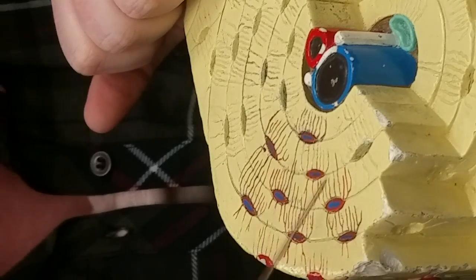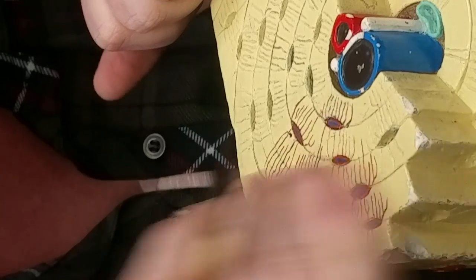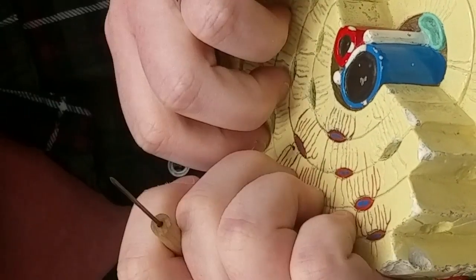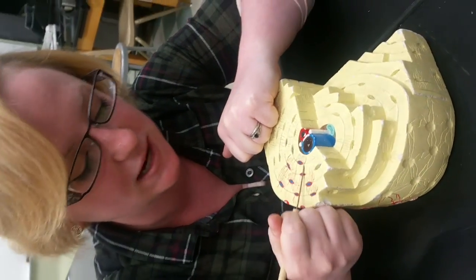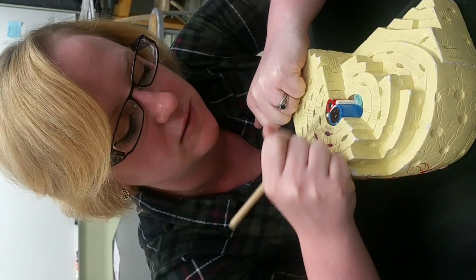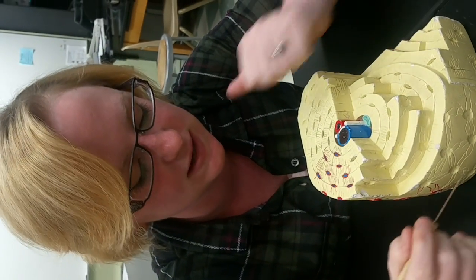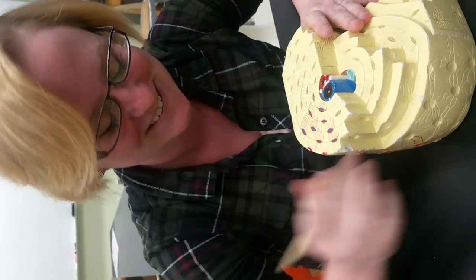So the way I always remember this is if you think about the life of this particular kind of cell, it can't move around, it's stuck in this one place. And it's in a solid matrix. Like, you know how bone is, it's hard. They can't move around and they're stuck in a solid matrix. So in order for them to get nutrients, they reach through these little canaliculi to get nutrients from this thing here called the central canal, which we'll talk about in a second. So I always think it's like reaching out little canals, it's reaching its arms out through these little canals to lick nutrients from the center. So canaliculi, that's what I always think.